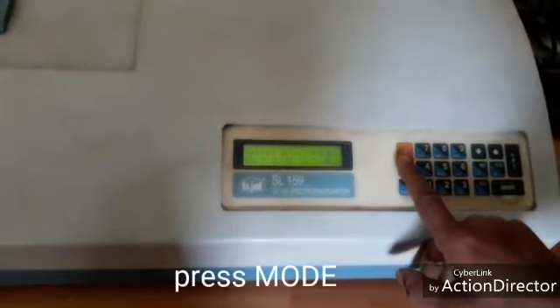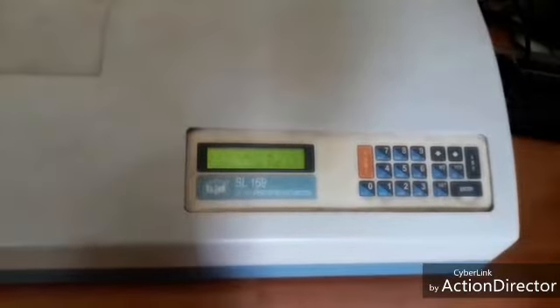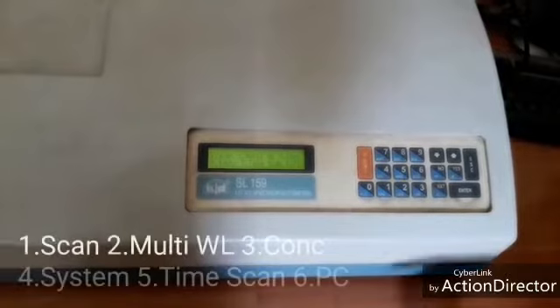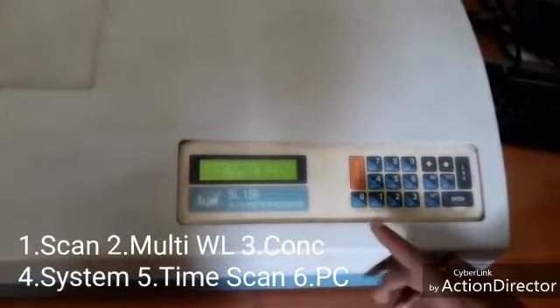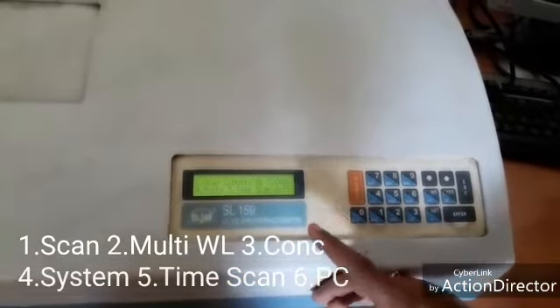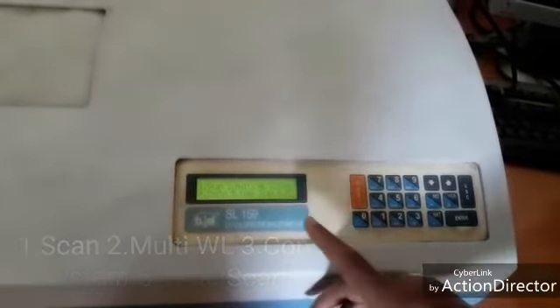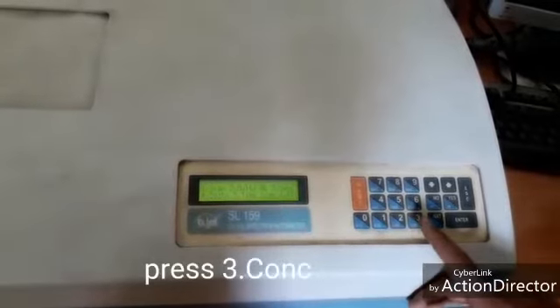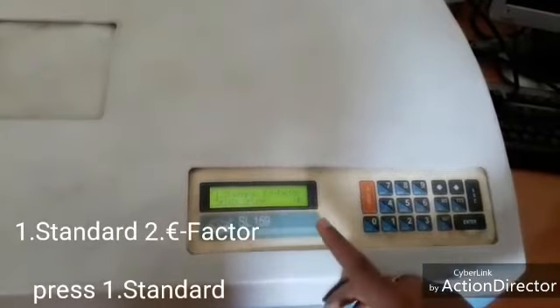Press mode. 1 is scan. Enter. 2 is multi lambda. 3 is concentration. We require 3. We press 3. Press 1. 1 is standard.